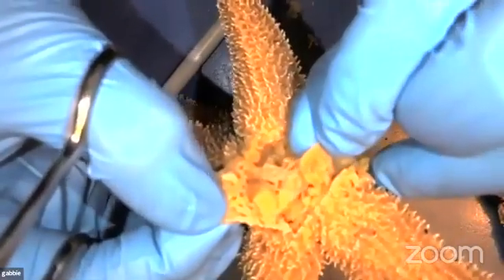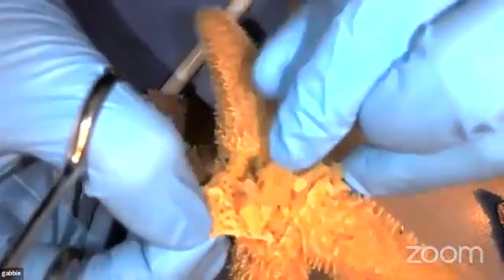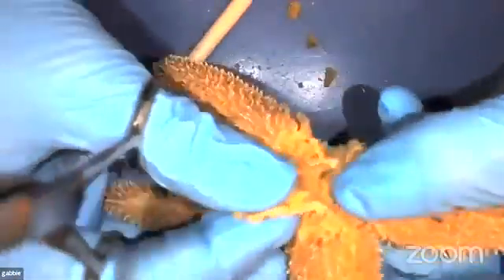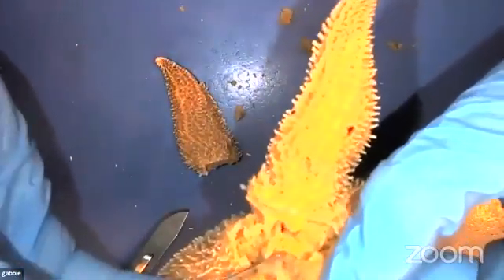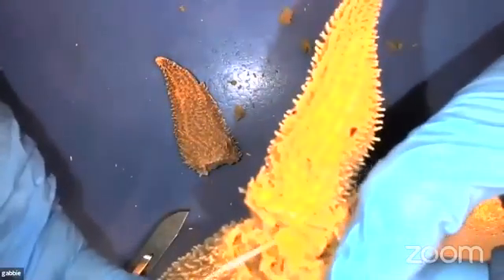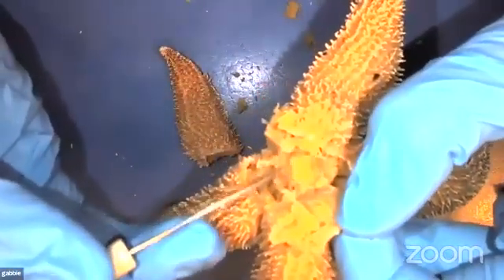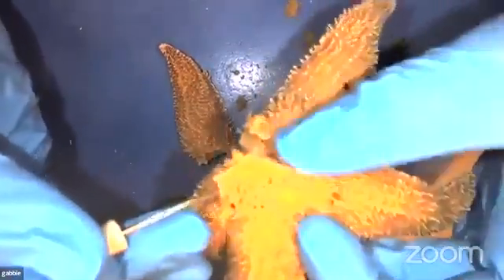Now, if we peel this back, you can start to see this stringy little thing, it almost looks like a plastic bag. This is their stomach. Now they have two different stomachs. One helps absorb food in the back, and one is what they shoot through their mouth. The one that they shoot through their mouth is a little more muscular, and that's going to be closer to the front here. So that's this one in here. That's a lot thicker, as you can see. And that's what they use to shoot through their mouth, absorb their prey, and start that digestion. So they have the two chambers to their stomach.